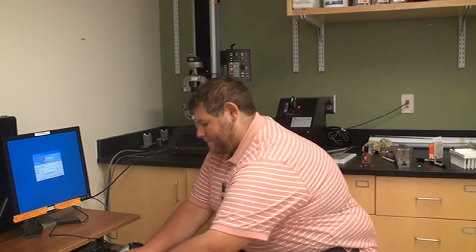Now while this boots up, which takes about 30 seconds or so, what you should do is log into the computer that's attached to the Instron. That's what I'll do right now.